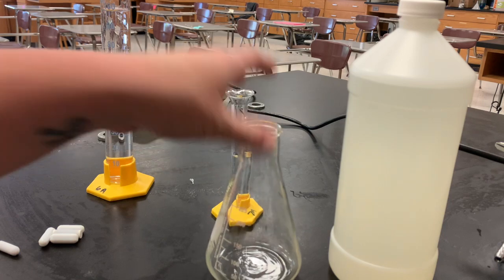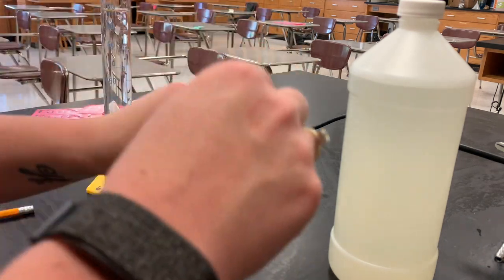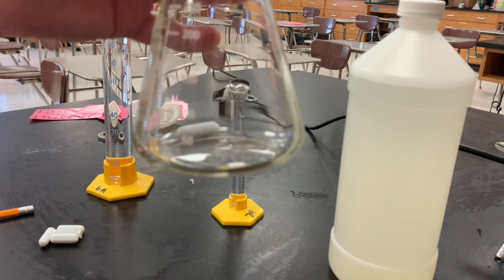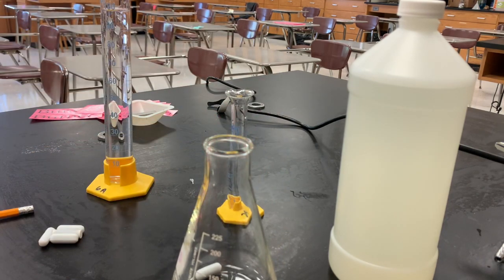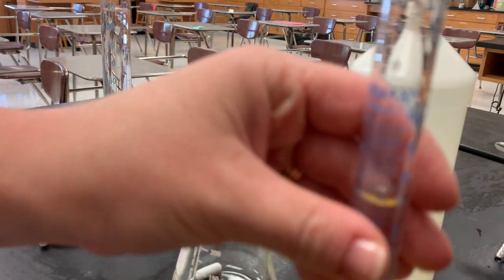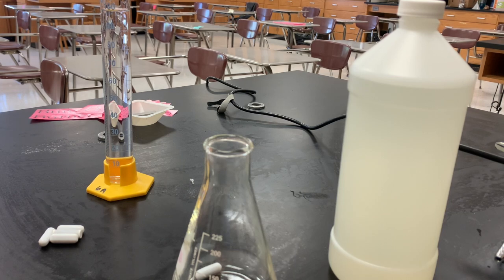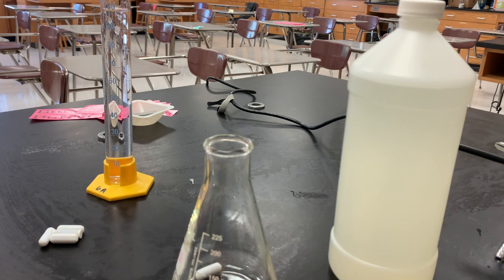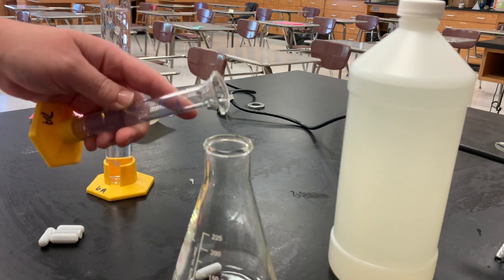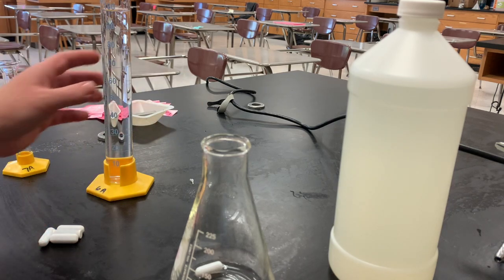Now we're actually going to go ahead and make our vinegar solution that we're going to test. This first step is not in your procedure — I'm adding it in to help with the stirring issue that comes up in this lab. I'm adding in what's called a stir bar — that little thing that looks like a pill. I'm going to put it on a hot plate, turn the stir on, and it's actually going to spin and stir your solution for you. I've obtained 7 mL of vinegar, so our vinegar is equal to 7 mL plus 100 mL of H₂O, just to give it a little more volume to work with. This is not actually changing the concentration of your acid, which is what you'll be calculating — you'll use the 7 mL for that.